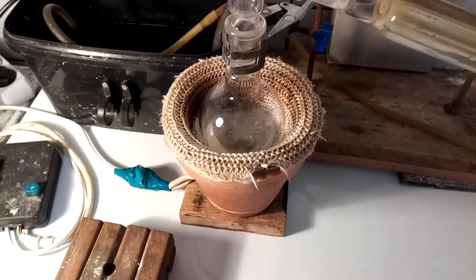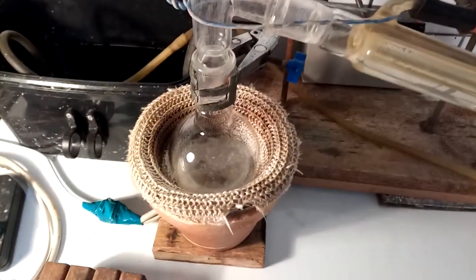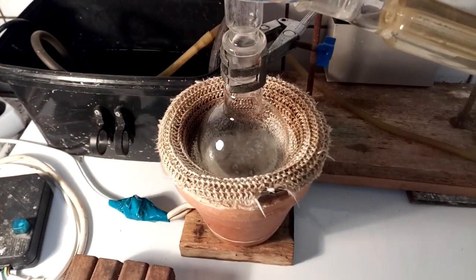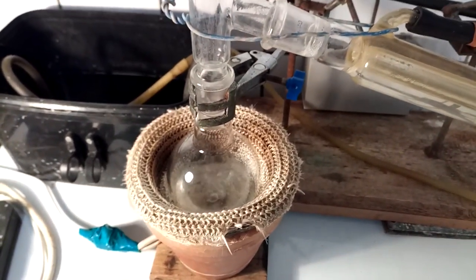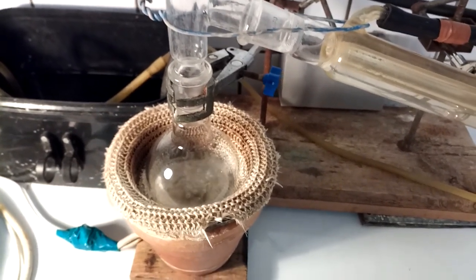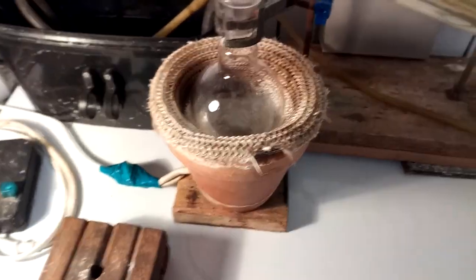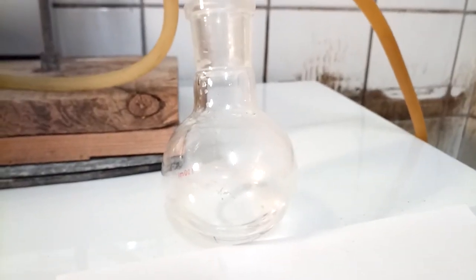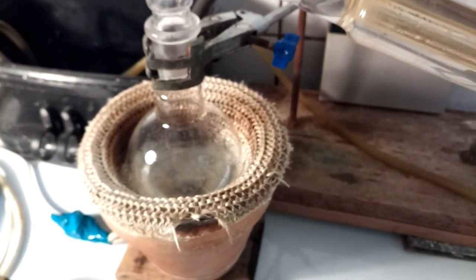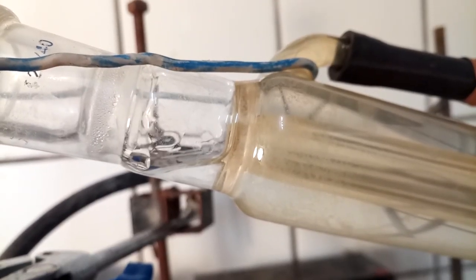The reaction runs at between 225 and 235°C and it shouldn't go above 260°C. We don't really have a way of measuring this here — if I had a two-necked 250 ml flask I could insert a thermometer, but I don't have one, so we're just going to have to eyeball it. I'll just turn it off when the stuff in here begins to smoke and put out weird fumes, because at that point we know all the formic acid has been used up and we need to add more. But it's working now and stuff is coming over.